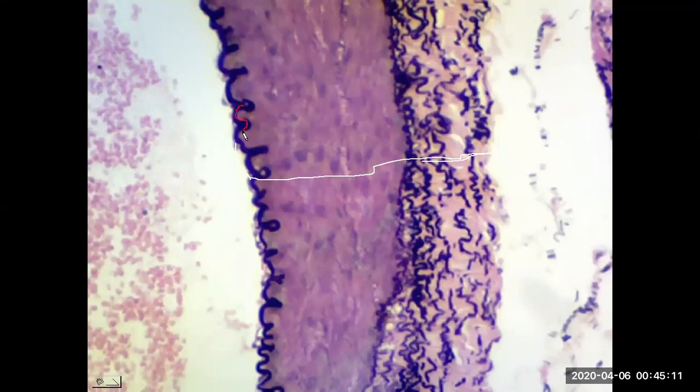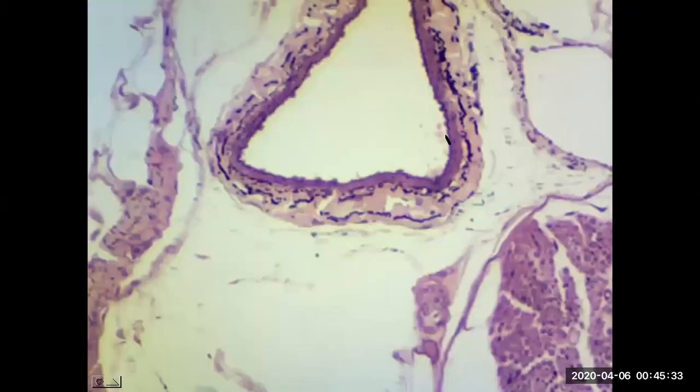The tunica interna on the inside, the tunica media, the middle layer, and the tunica externa is now that superficial layer. And they're much thicker for an artery. And here zoomed in on the wall of a vein. Again, the three layers are present, but the tunica media is much thinner. In fact, you notice the thickest tunic layer for a vein is the tunica externa. And again, the lumen is the hollow interior.